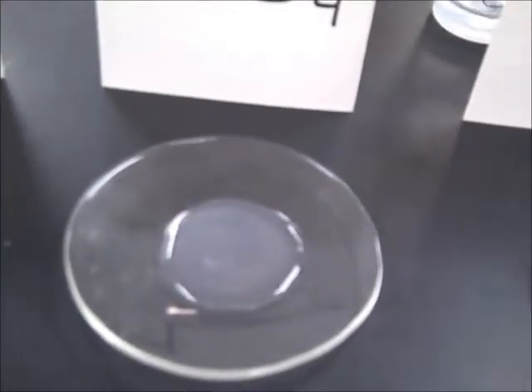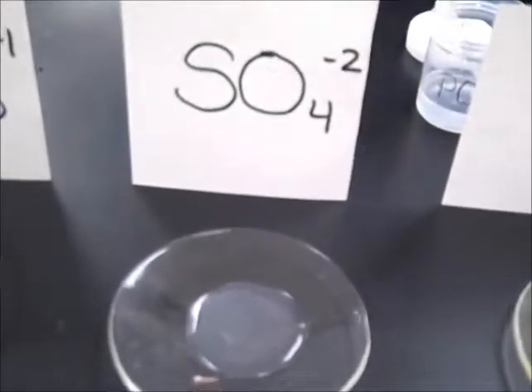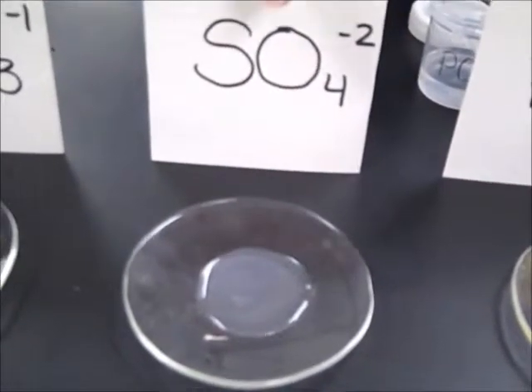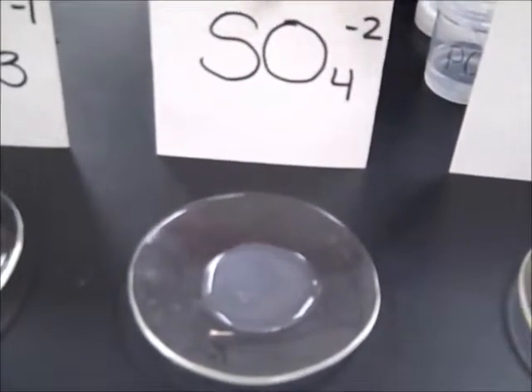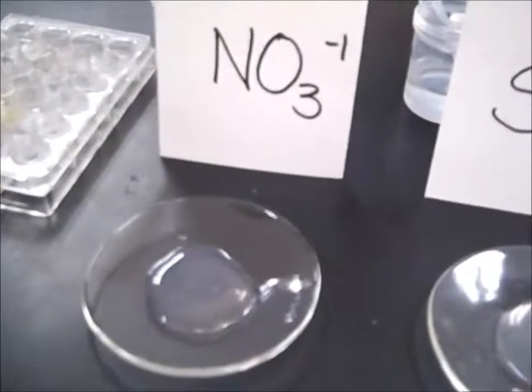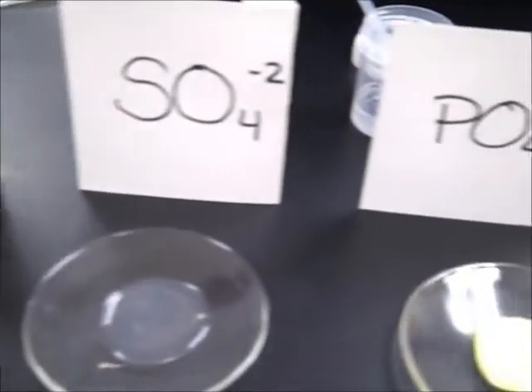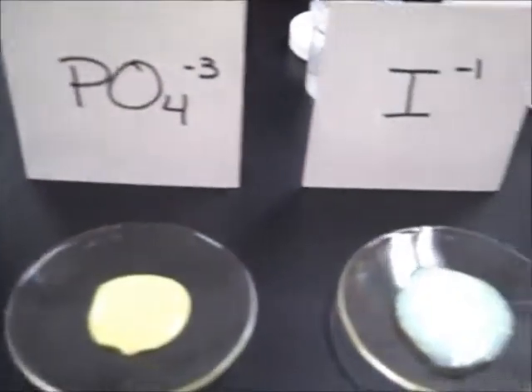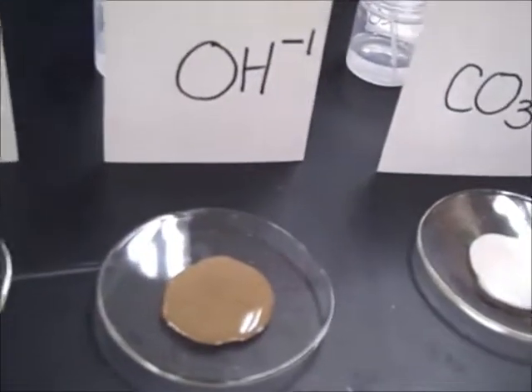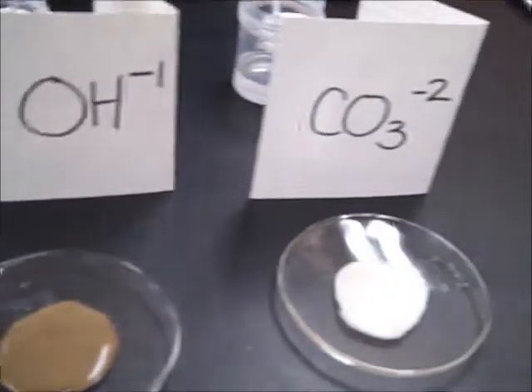All right, back to the silver in the nitrate. I agree, that is cloudy. See, that's the silver and the sulfate, and that became cloudy on you, Nick. Now the silver and the nitrate, though, no reaction. Not at all. Nothing happening there. Okay, so recap there, looking at all the good stuff. I've got lots of great adjectives to describe that one, but nothing really school appropriate.